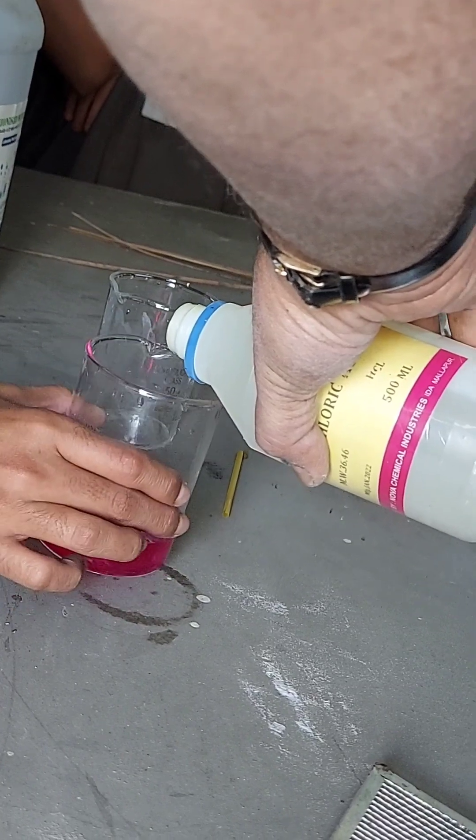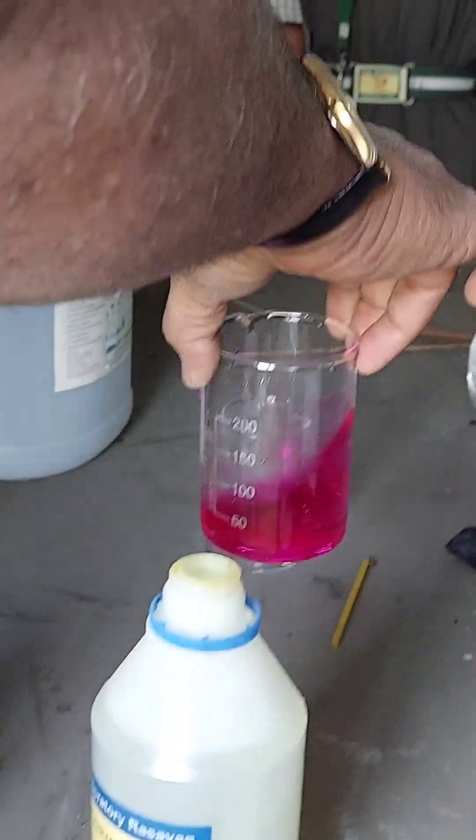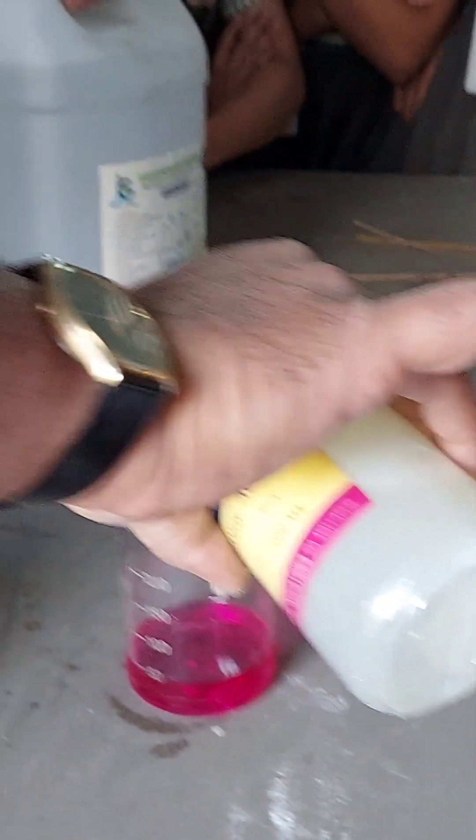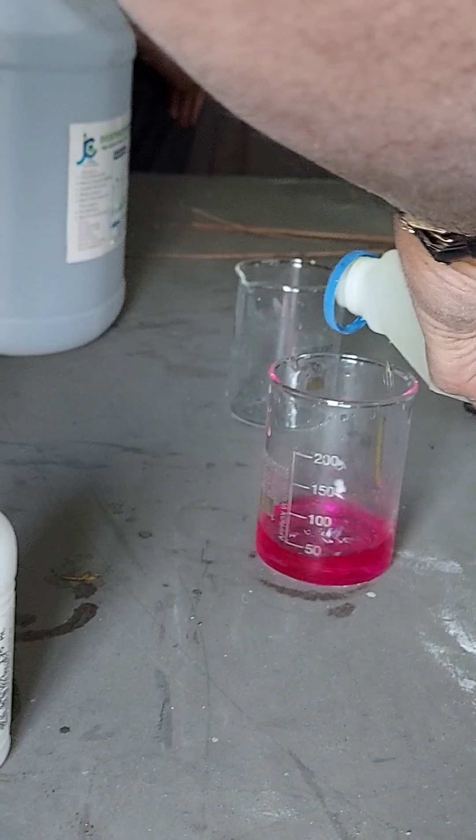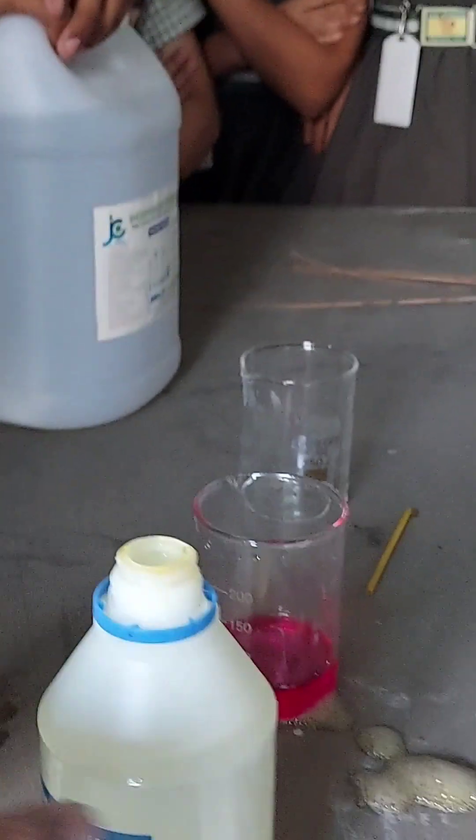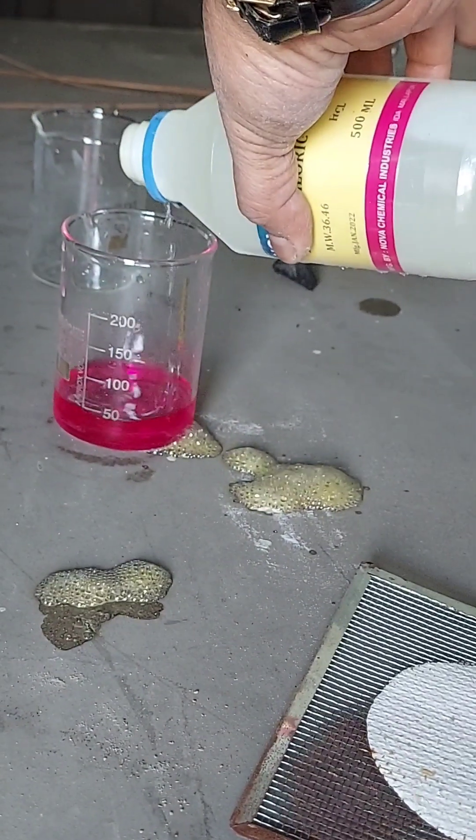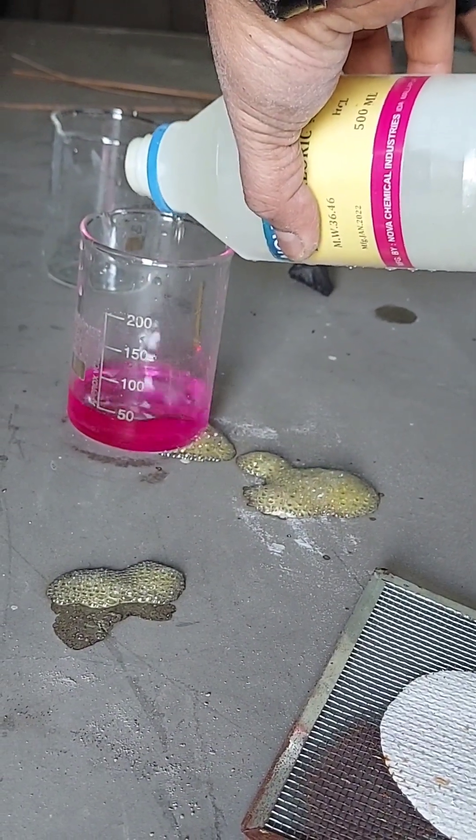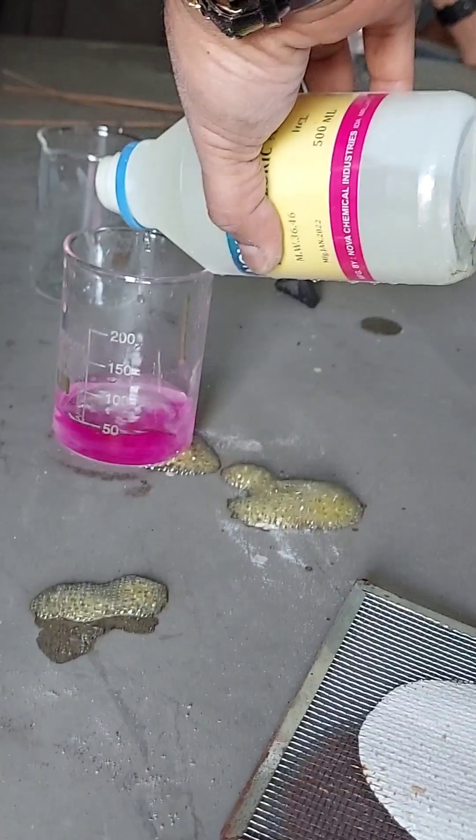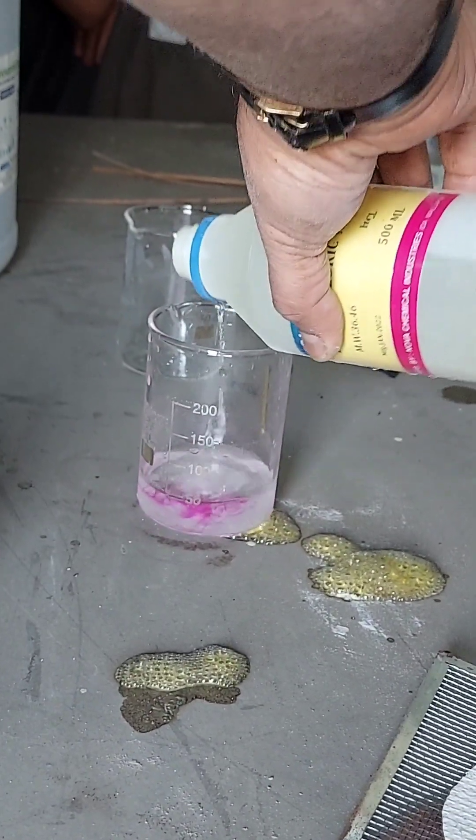You should stir. It's not getting neutralized. You should add more. See, can you see it's colorless now? Yes, yes, yes, now see.